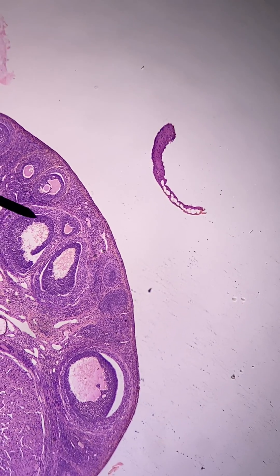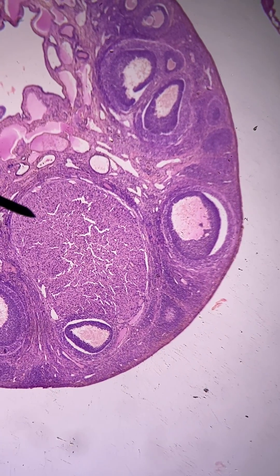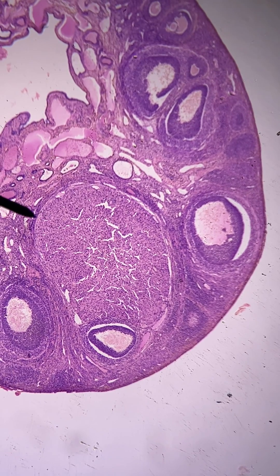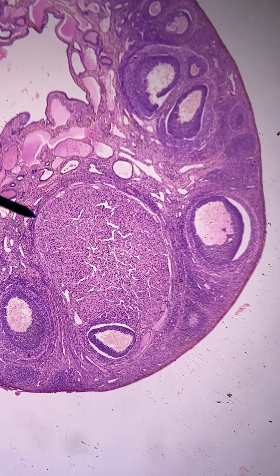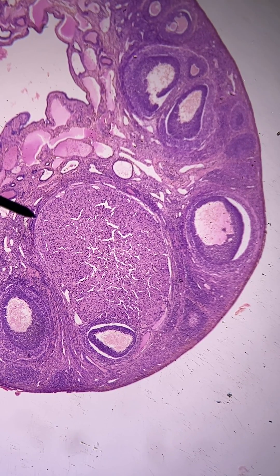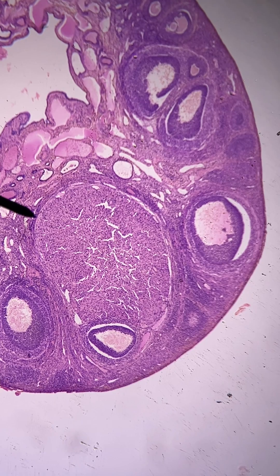This big structure right here, this big sort of cloudy-looking structure that the pointer is pointing at, is called a corpus luteum — a luteal body.